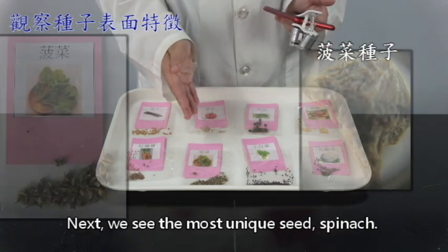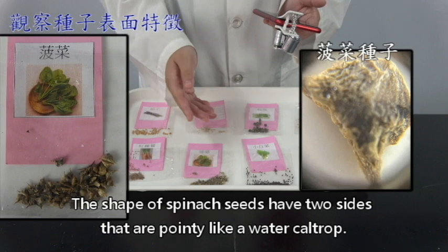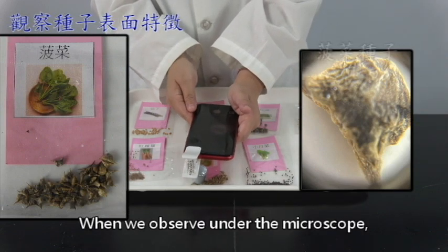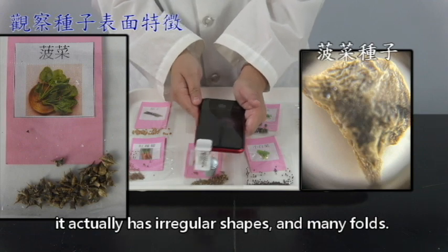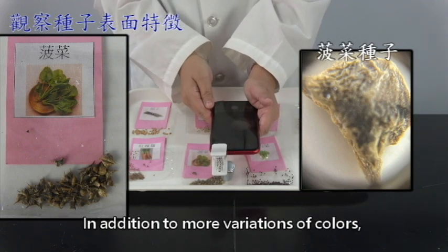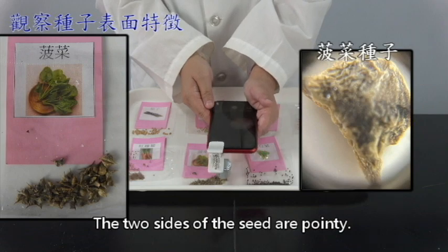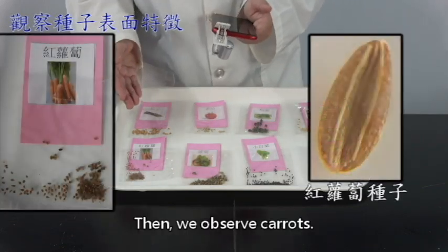Next, we see the most unique seed, spinach. The shape of the spinach seed has two sides that are pointy like a water caltrop. When we observe under the microscope, it actually has irregular shapes and many folds, in addition to more variations of colors. The two sides of the seed are pointy.